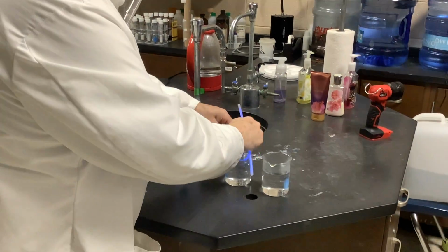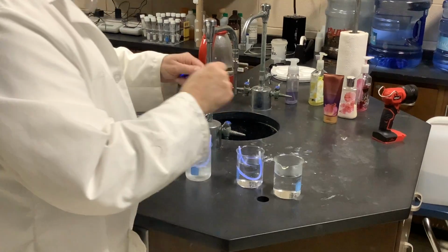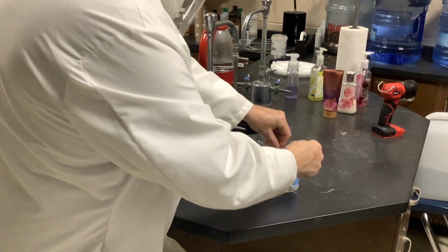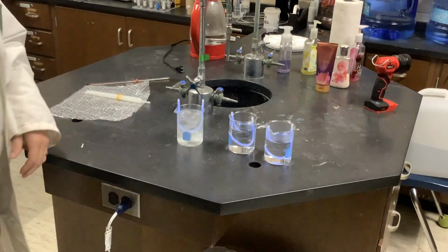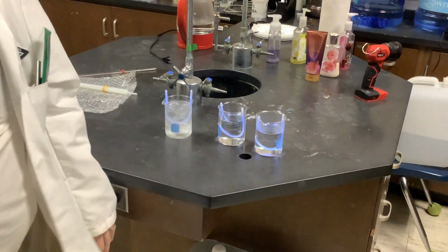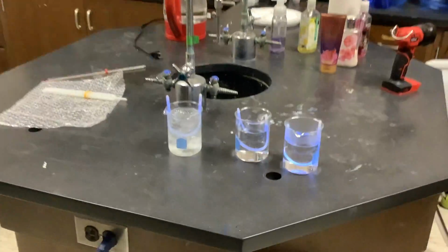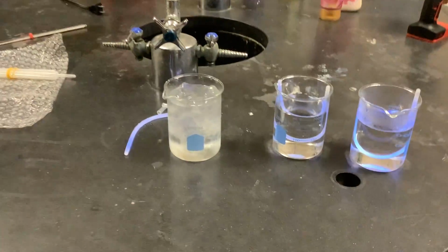I'm going to go turn out the lights so that our differences can be more dramatic. This will only take 1 more minute, then we'll answer our questions. Okay. So here. That's one.